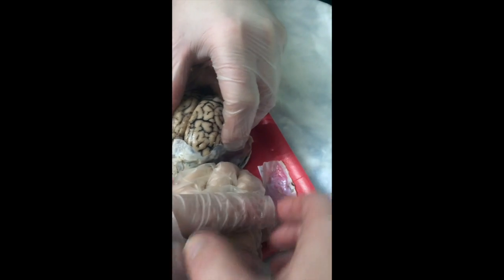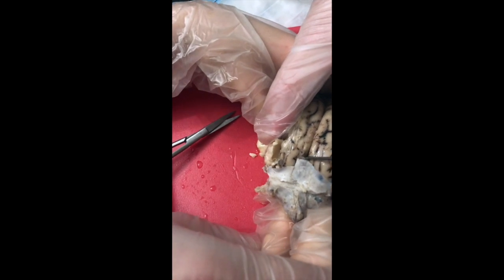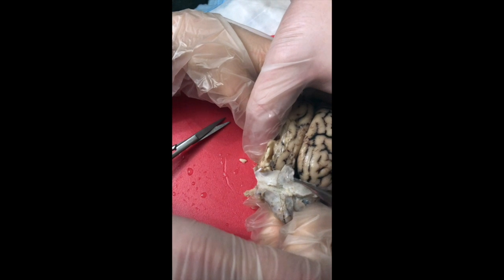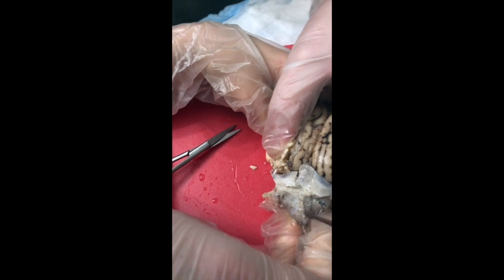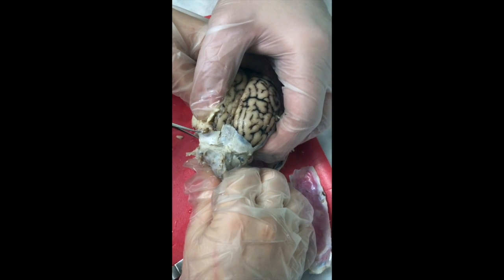Squeeze. Yep. And then lift in the middle. And you'll notice that it comes apart right here. Don't pull too hard, guys. And there's a big space right here. And you need to cut along the edge right there. Inward. On this side.